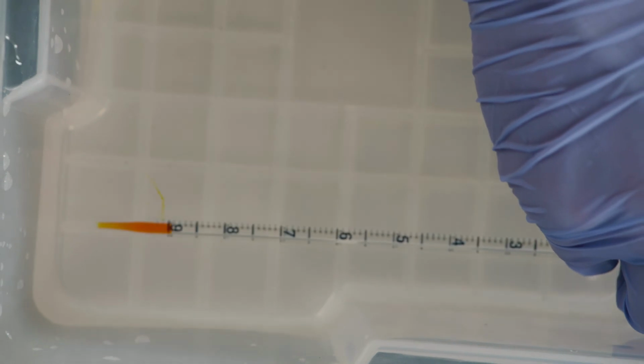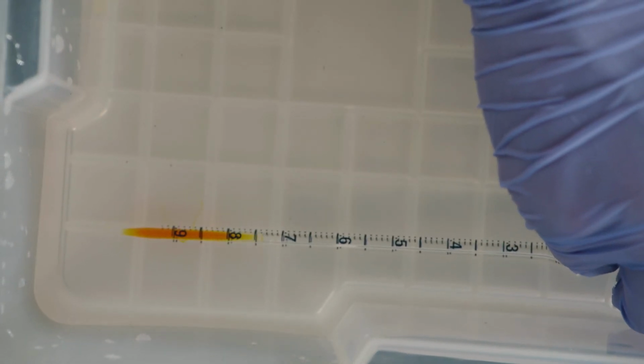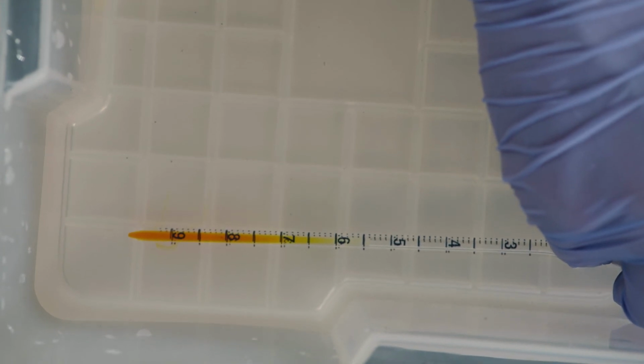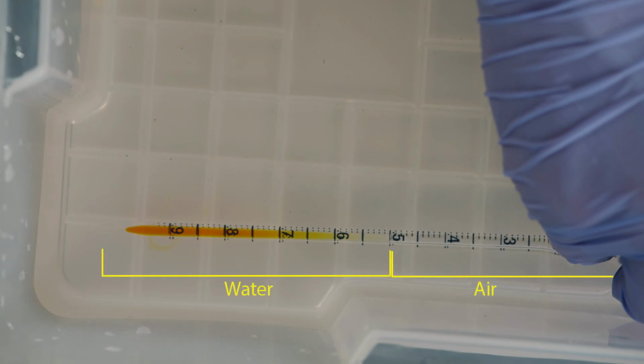experiment is complete. The purpose of the respirometers in this experiment is to show changes in volume caused by any cellular respiration occurring in the vials. When the respirometer is submerged, part of the pipette fills with water, while the rest remains filled with air. The volume of air in the respirometers is measured by noting the point to which the water level reaches within the pipette. For example, in this pipette, the water level ends here, which means that there is 0.5 milliliters of air in the pipette. Calculating the difference between the volume measurements you take over time will give you the change in volume in the respirometer.